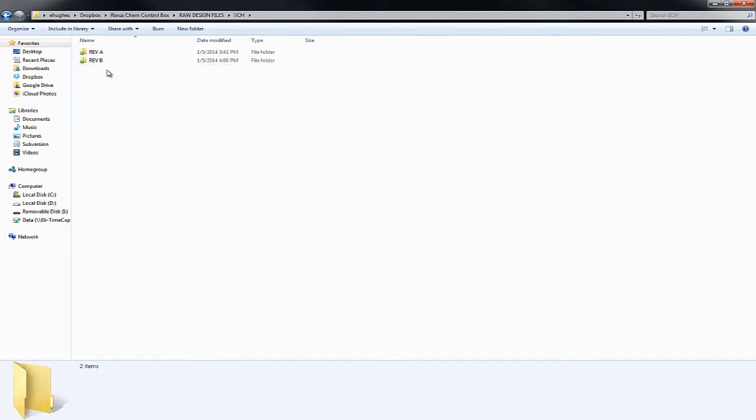Now, you'll see a Rev A, Rev Alpha, Rev Beta. The current hardware as built today is Rev A. Now, there were a couple of minor fixes I did in Rev B. You should be able to look at either one of these, and I'll point out what the difference is. I'm going to look at Rev B, and I'll show you the difference, but from a user perspective, you won't even notice.